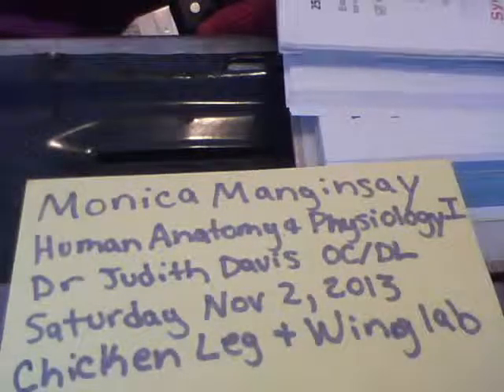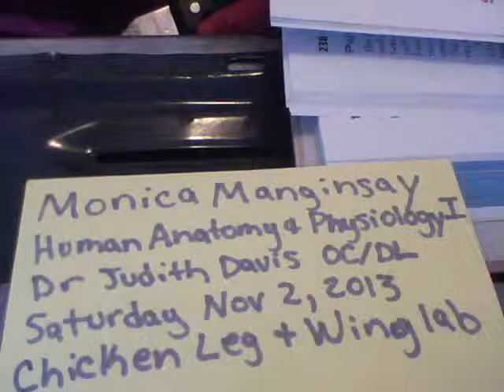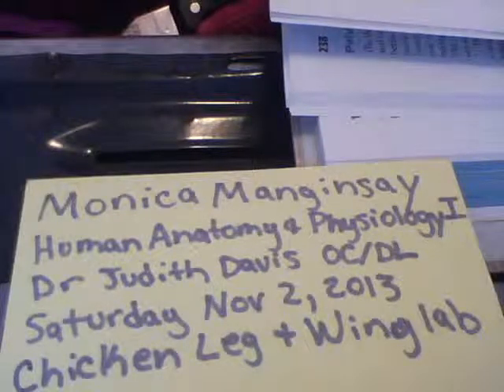Hello, I'm Monica Manginsai, and I am doing the chicken leg and wing dissection lab. This will be the chicken leg dissection.